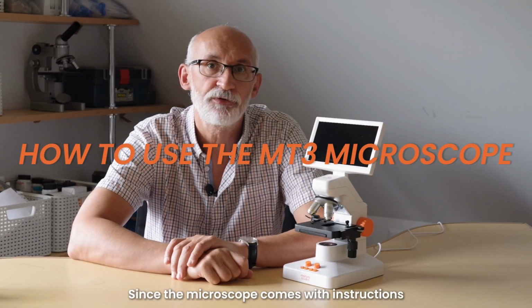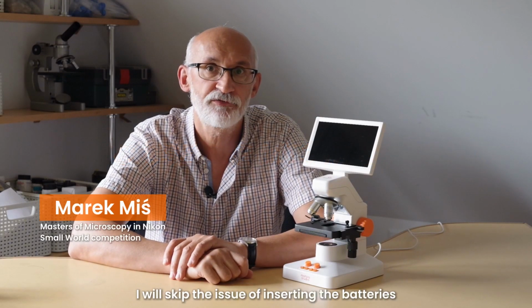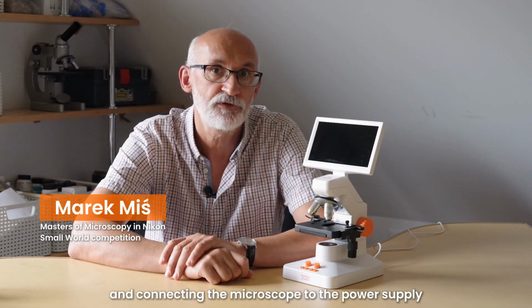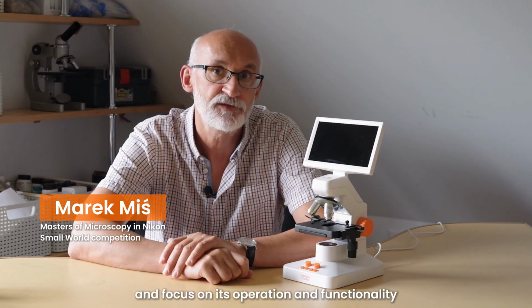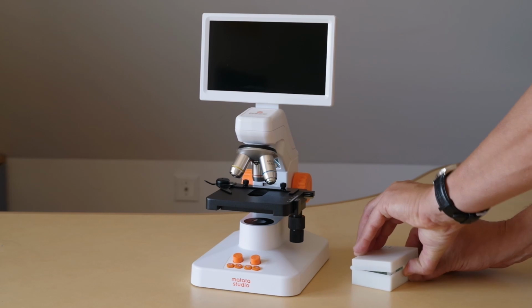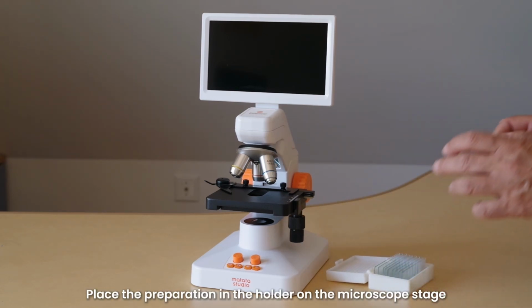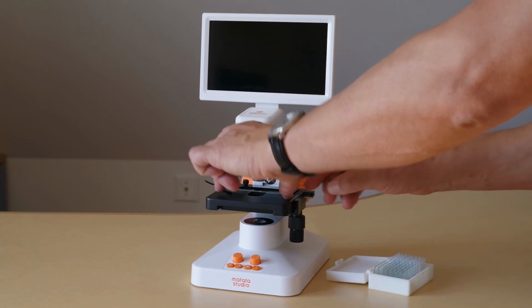Since the microscope comes with instructions, we will skip this issue of inserting the battery and connecting the microscope to the power supply, and focus on its operation and functionality. For this purpose, we will use one of the preparations attached to the microscope. Place the preparation in the holder on the microscope stage.